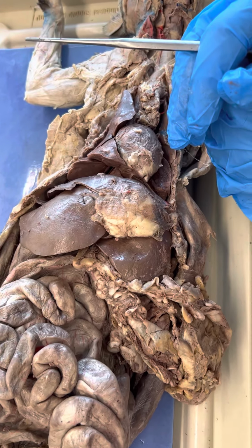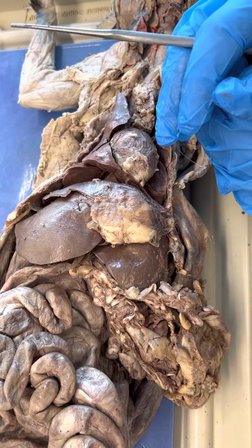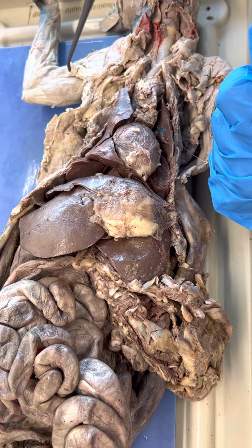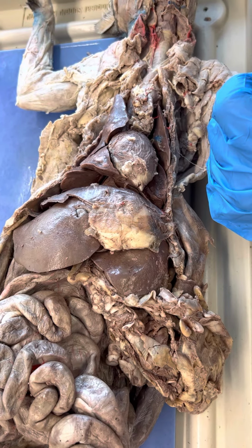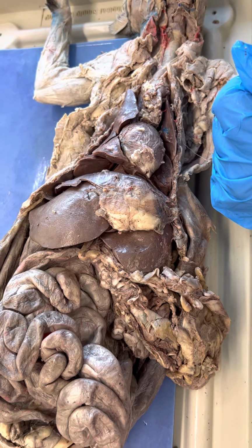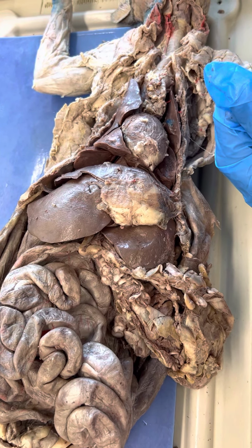Okay. So then pharynx, oropharynx, nasopharynx, laryngopharynx, you have to be on the model. I would only ask that on a model. You can't see it on here. Yeah, that's not realistic, what you can find on the cat.